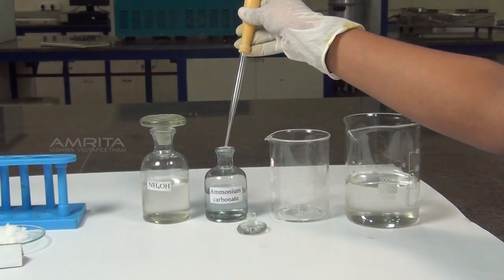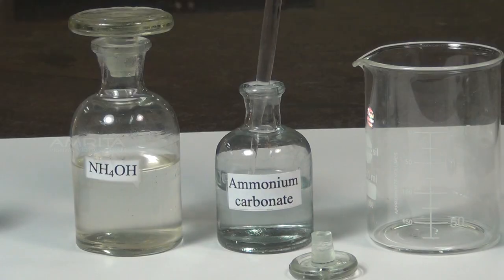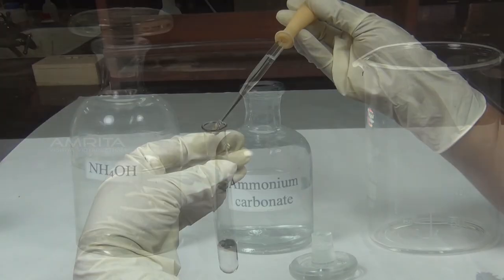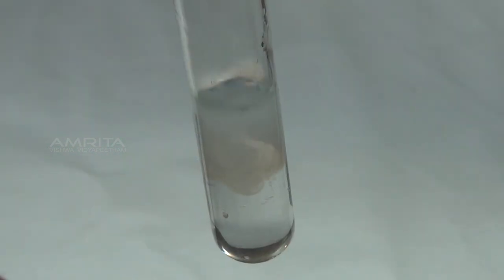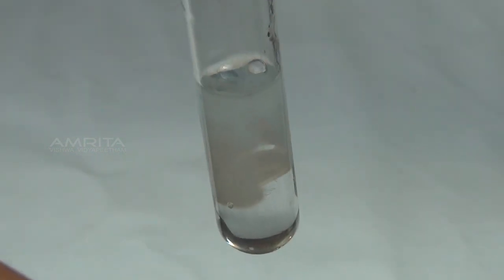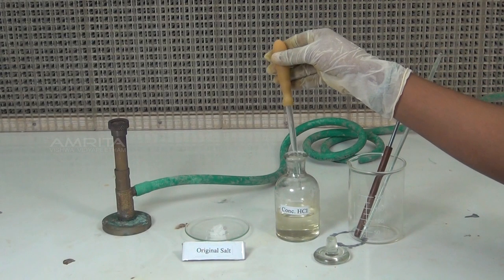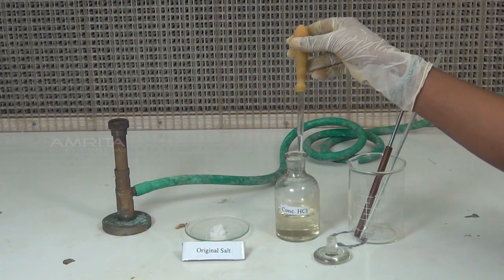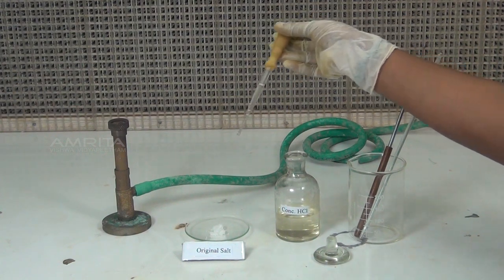In group 5, strontium ions are precipitated as their carbonates by adding ammonium carbonate to their solutions. Our aim here is to test for the presence of strontium ions in a given salt.